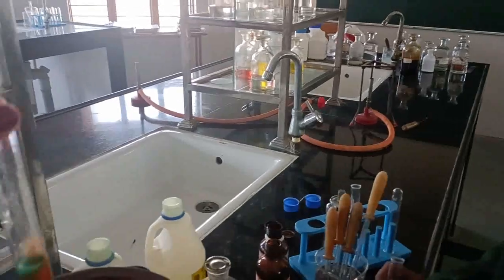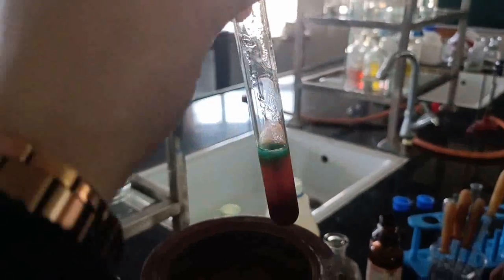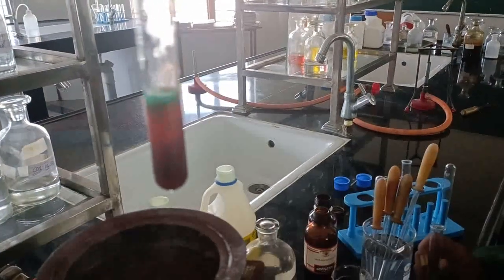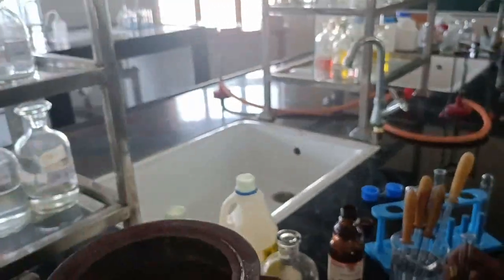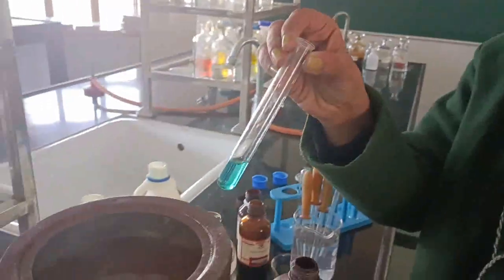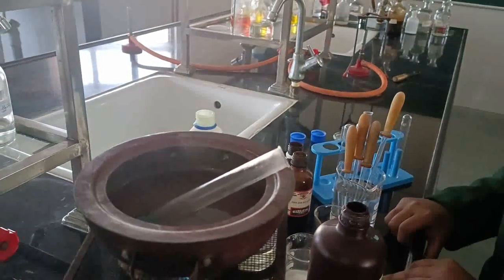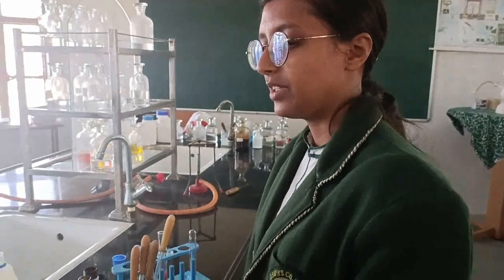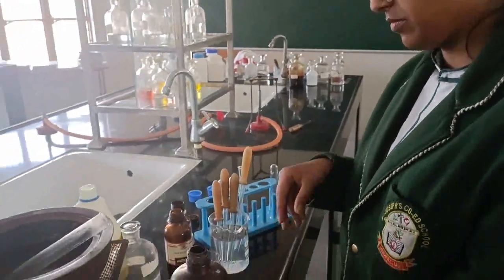This was the test tube which we kept earlier, the Fehling's test. I told you that it will change to reddish precipitate and you can see the test is complete. This is the observation of the Fehling's test. Now this is the next test tube with Benedict's solution. Please keep it: carbohydrate plus Benedict's solution, and on heating this will also give us reddish precipitate. Meanwhile this is getting heated and gives us the reddish precipitate.